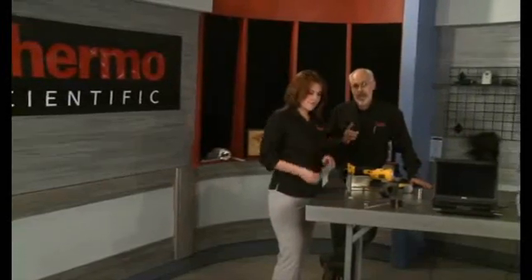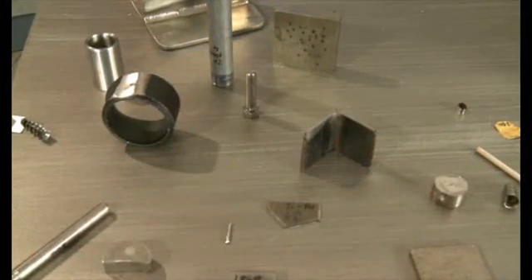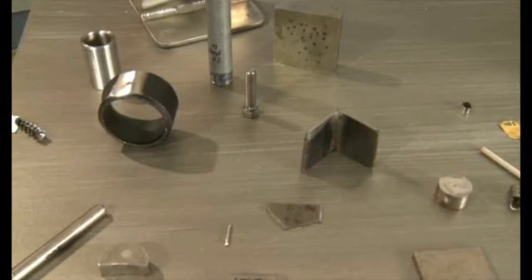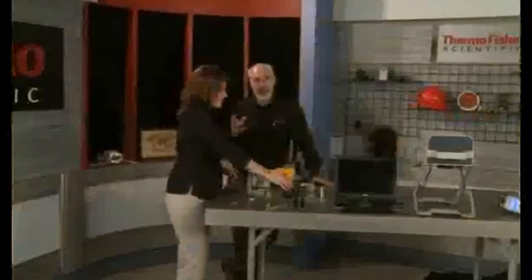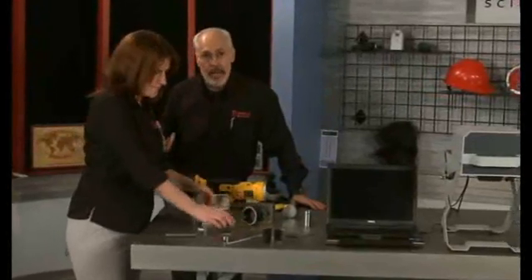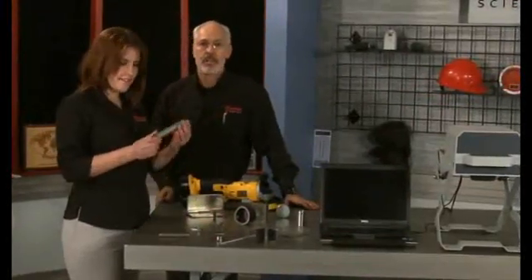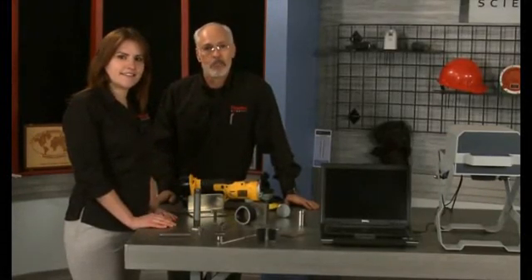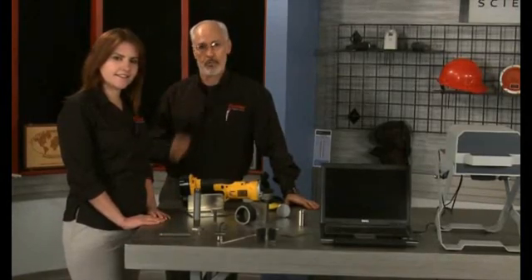Most chrome moly, stainless steel, and nickel or titanium-based alloys need little or no sample preparation when the surface is seen to be clean. However, because XRF is a surface-sensitive technique, it's important that the surface be both clean and representative of the alloy. For accurate results, it's absolutely necessary to remove any non-representative surfaces, such as paint, rust, scale, zinc coatings or platings, or any non-representative alloy surface. The surface measured must always be the intended target material. Whatever's on the surface is what the instrument will measure.